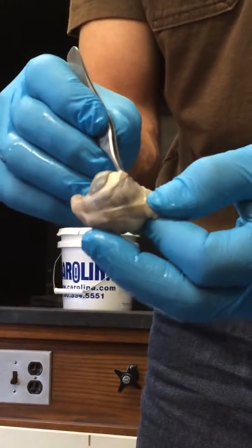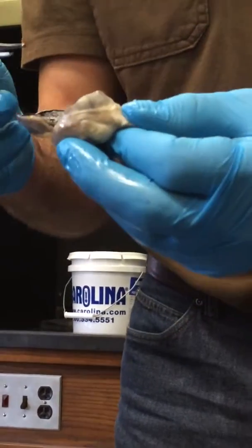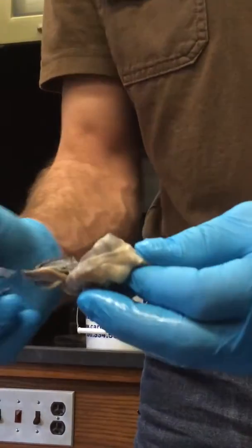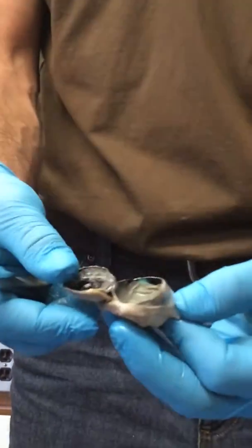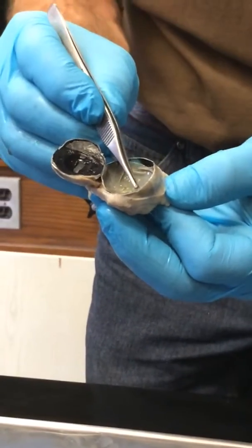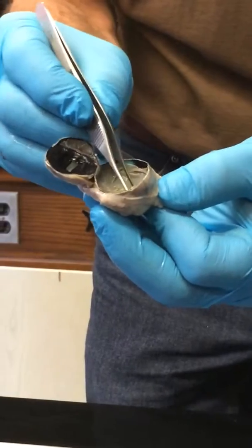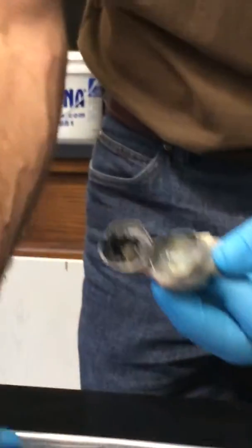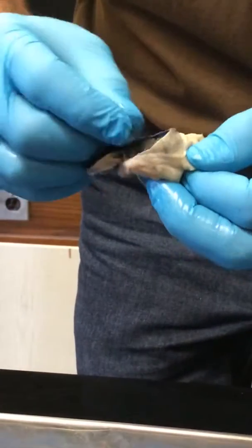So the white, the sclera, is the tough portion of the eye, and it is really tough. And then in the posterior, what does light strike in the back of the eye? The retina. So the retina is very, very thin and membranous, and I'm trying to do this without destroying it, and it might be better if I don't use a tool, but see, there it is.